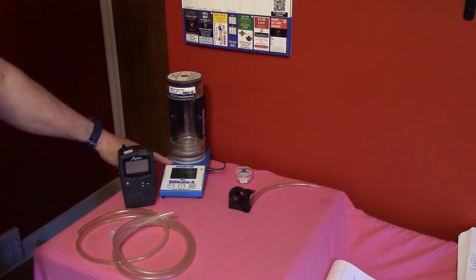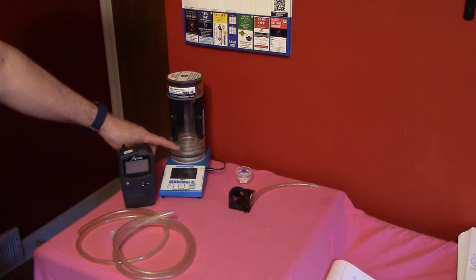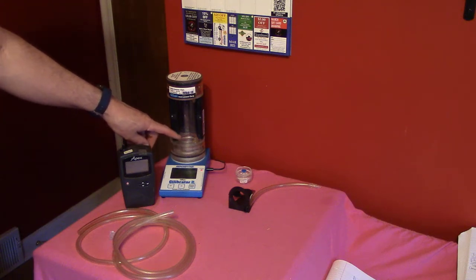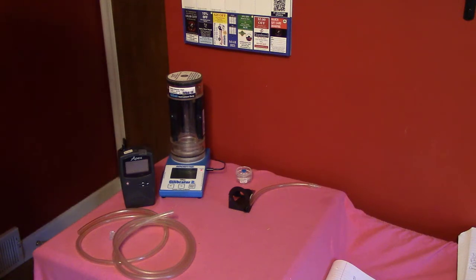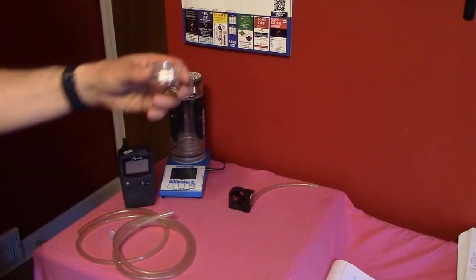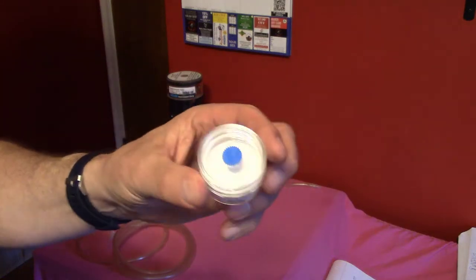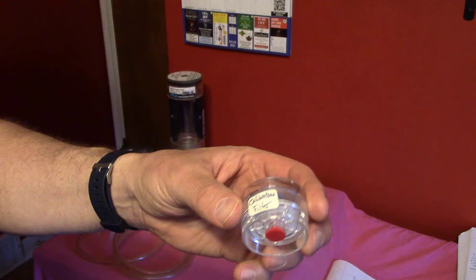I've got a flow calibrator. This one is a bubble meter, and it calibrates the airflow by measuring the time it takes an air bubble to rise through this tube — an air bubble that is moving with the airflow. I've also got a calibration filter in a cassette, and you can see the white filter inside the clear plastic cassette.